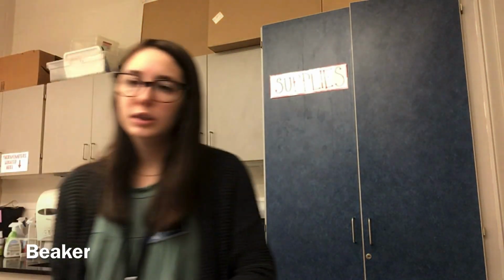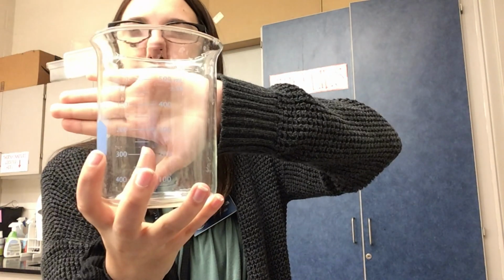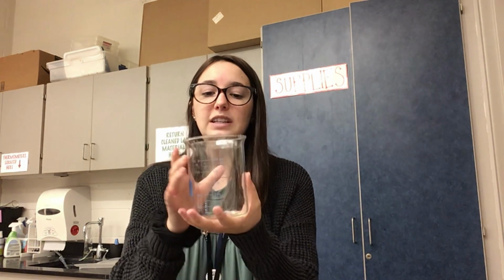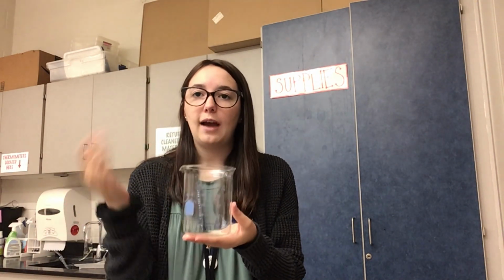Number two is a beaker, which we've all had experience with. Beakers are used to measure volume. They come in all different shapes and sizes. They are glassware. Here's one beaker that I have. I have multiples. This one is a 600 milliliter. These are a lot more expensive than what we'll use. However, beaker volume is not accurate. Remember, your estimated digit is always going to be in that tens place. You're never going to have an exact measurement for a beaker.